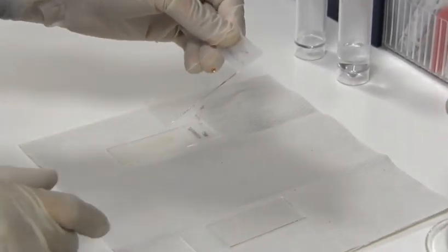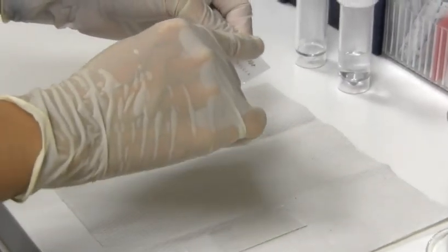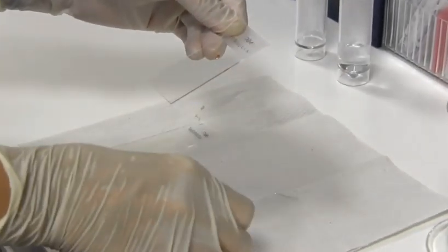You pick up the slide with one hand, and the label side is facing away. Then you pick up the spreader slide.